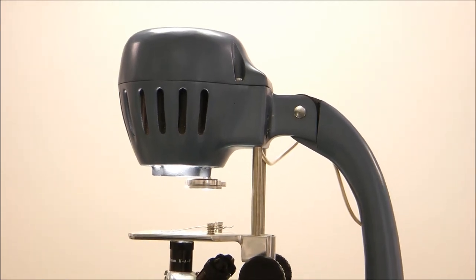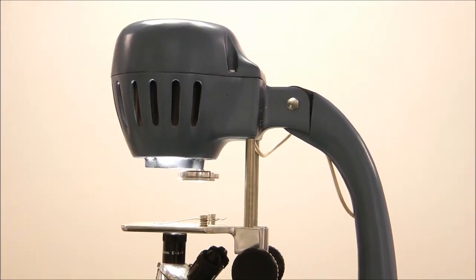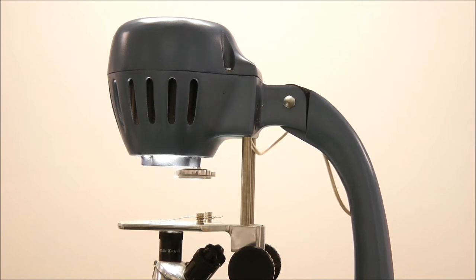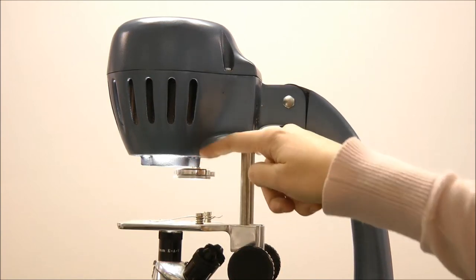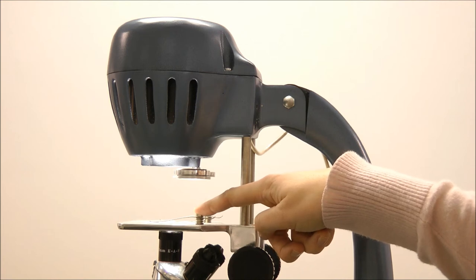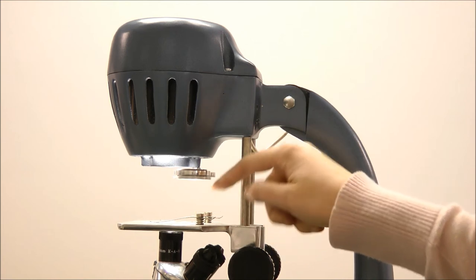The microprojector works like a traditional compound microscope except that it's inverted. At the very top you will have your light source. Then you will have your stage with your stage clips to put your slide on.